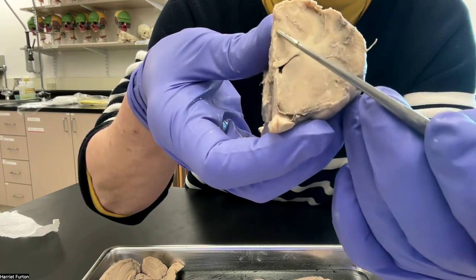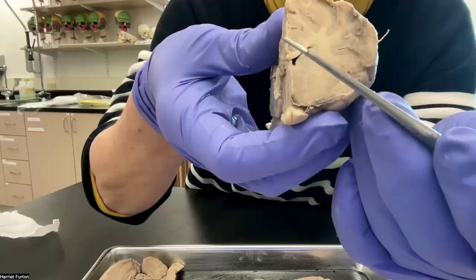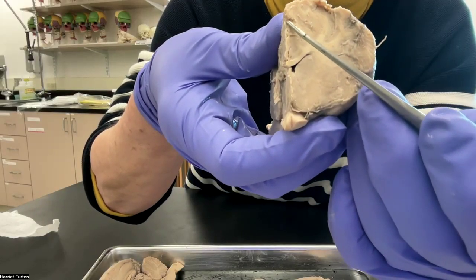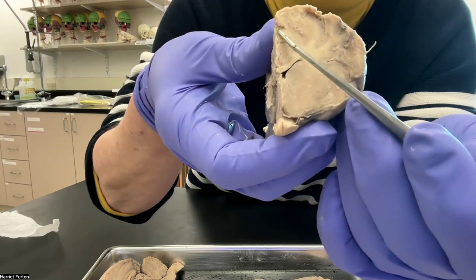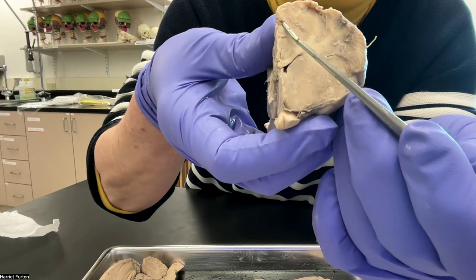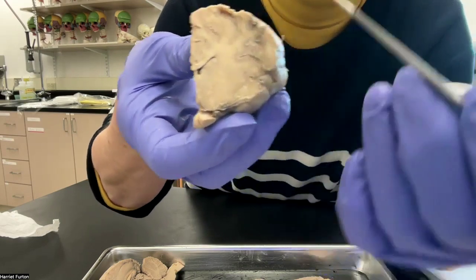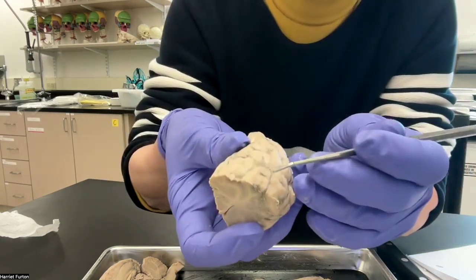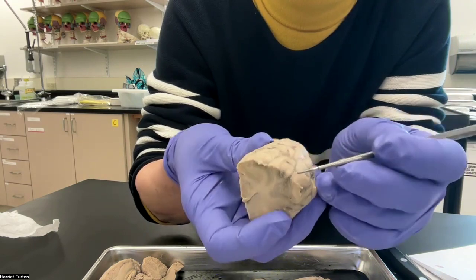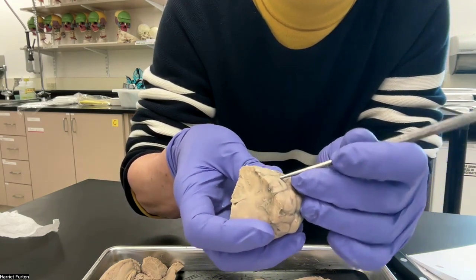And we have the sulcus, or the sulci, like the hills go into a ditch, I would call it. So these are the sulci, and these are the gyri. That is a gyrus.